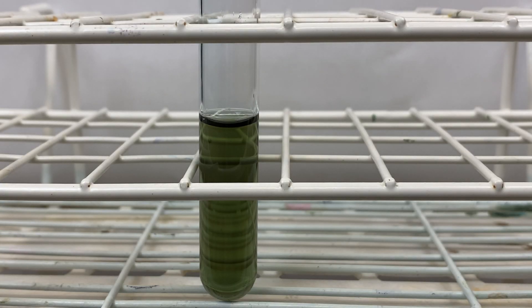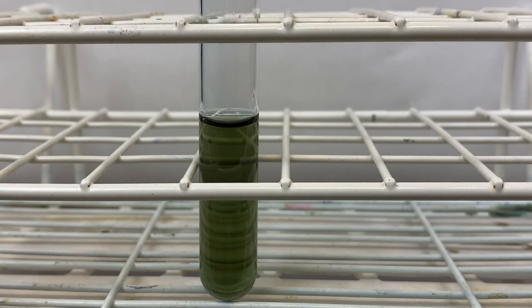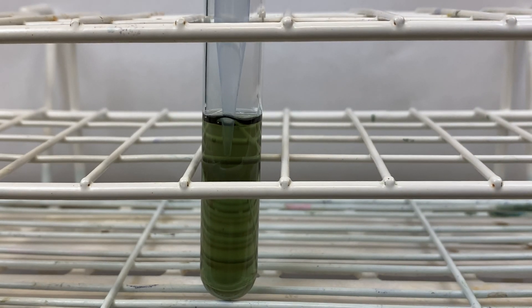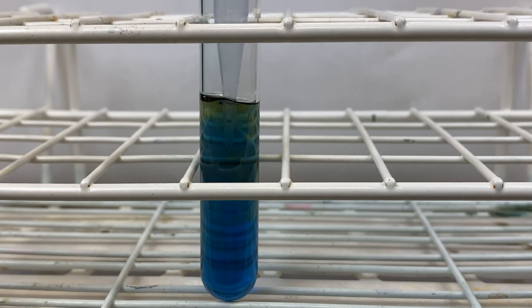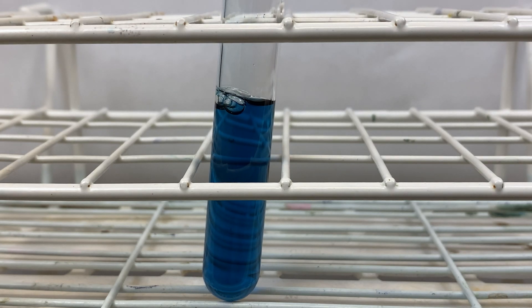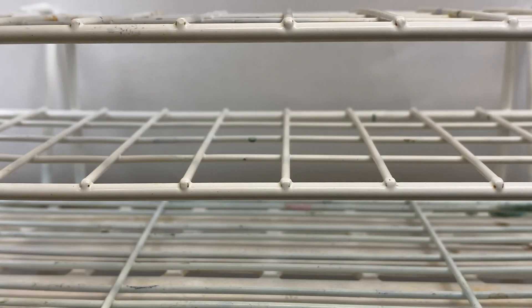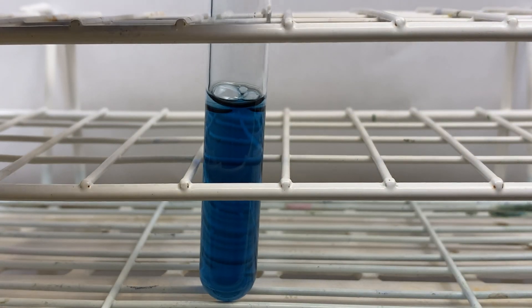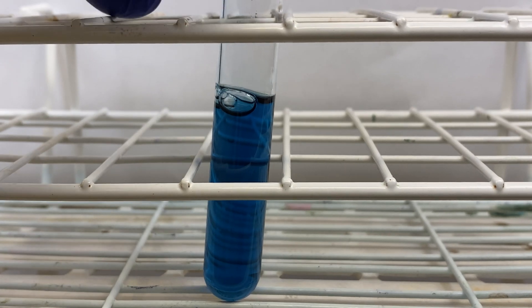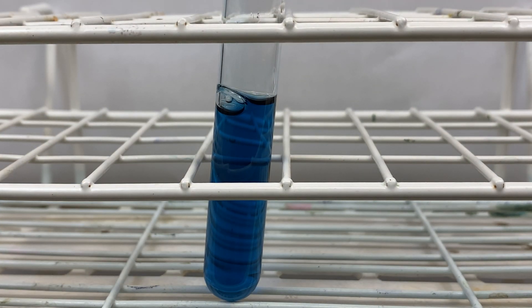Let's start by showing you how the Bradford reagents react with protein. You can see it's a brownish-green liquid. When we add the protein, it turns a blue color. In my protocol, I used 0.2 mils of each solution, 1.8 mils of Bradford reagent, and then I let them incubate at room temperature for five minutes.